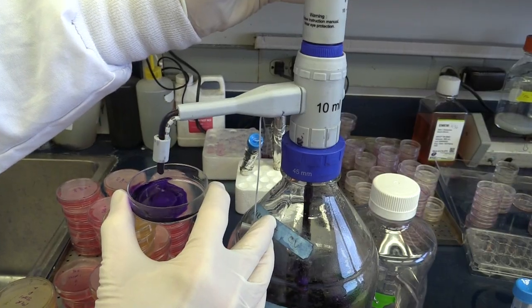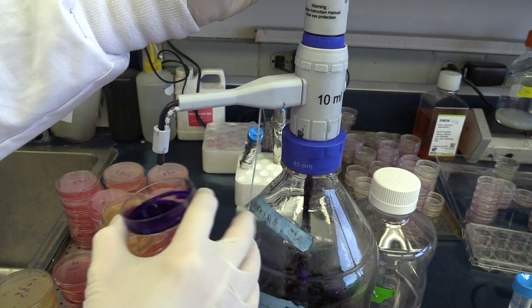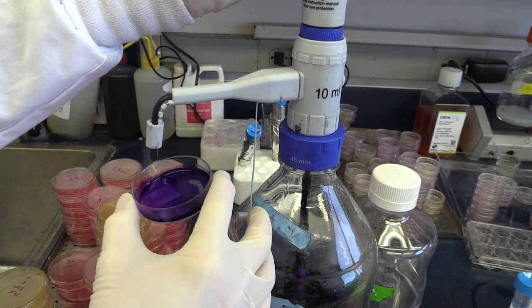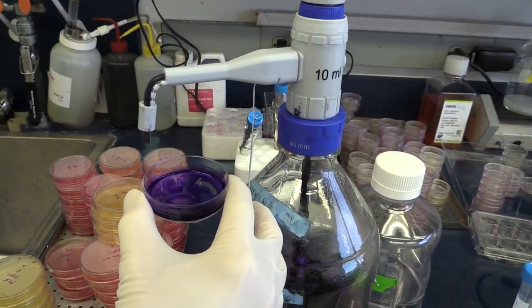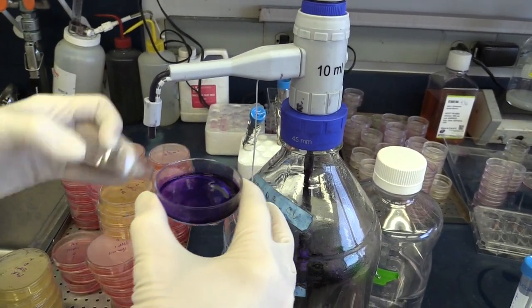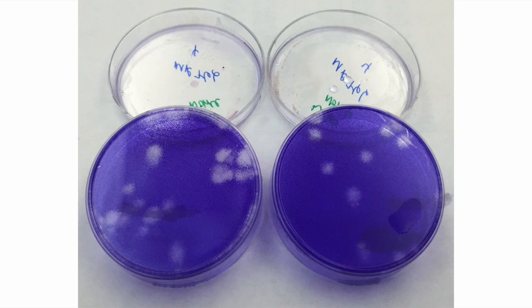Finally, we add a dye to the cells, and we use a vital dye called crystal violet, which stains living cells. The plaques are then visible as clearings against a purple background — clearings where the virus has killed off all the cells.